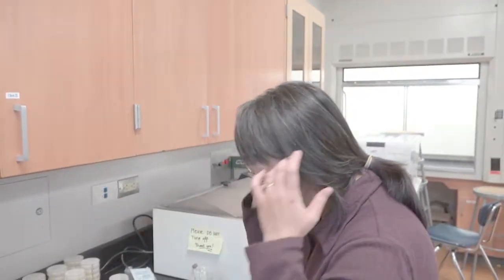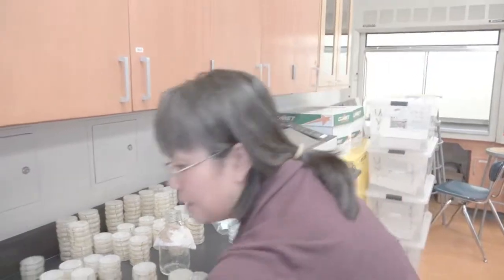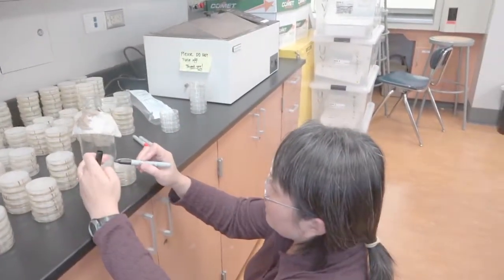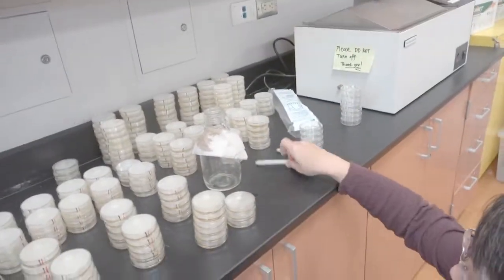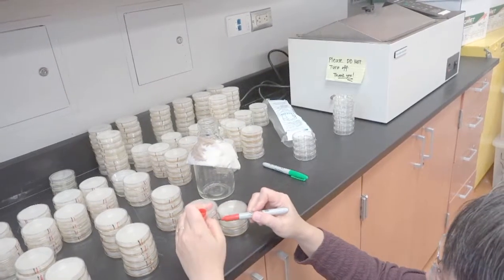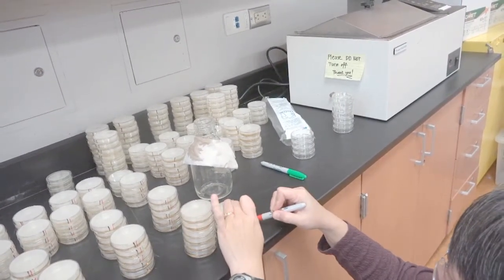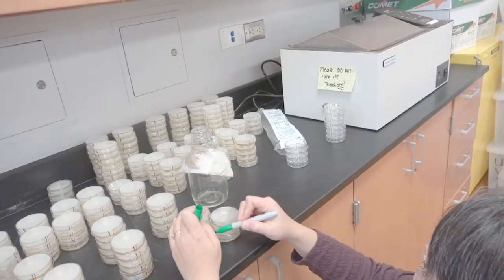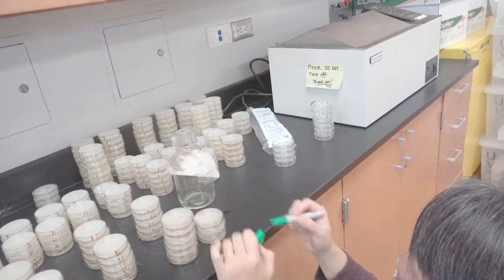I didn't label these guys, so I better label them now, just so I know exactly what they are. I'll do the black, and the red, and then the green.